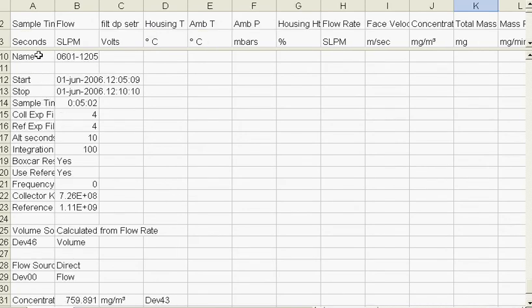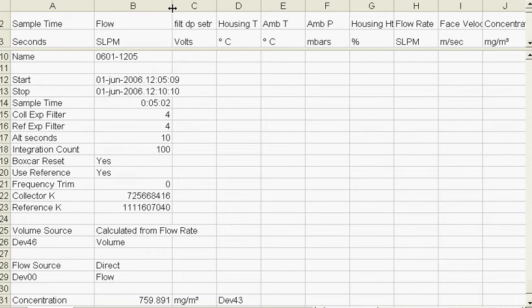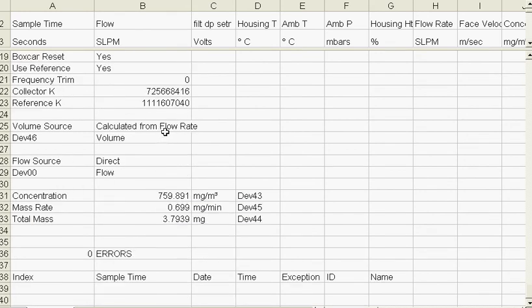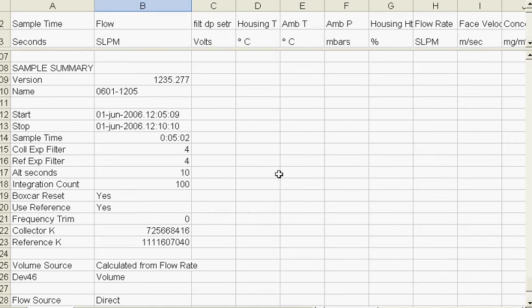So here we have the name of the file, the start time, stop time, the time of the sample, the filter. Some of these variables have to do with parameters that can be used to determine what happened during the sample, even if the indicated values I show are incorrect because of incorrect assumptions on calibration coefficients. So all of these show what happened, what the collector K were and the reference K were. It's like having the position of a potentiometer known at the time of the test. We also know what devices were used, and we end up with our final answers, if you will, that folks care about. So that's the big overview of that one.